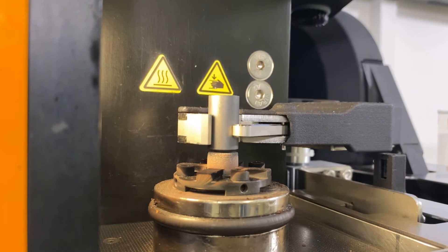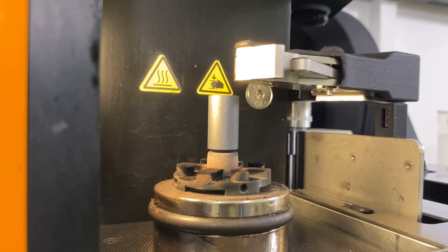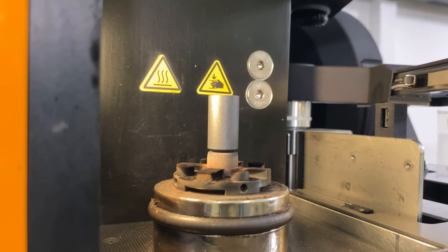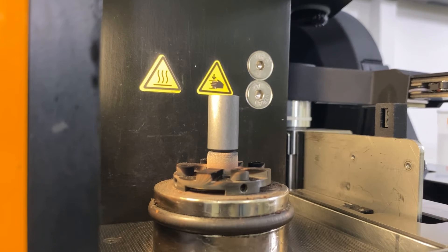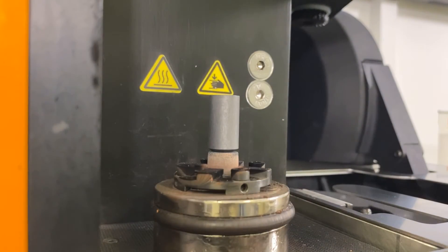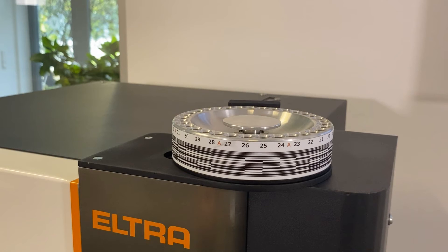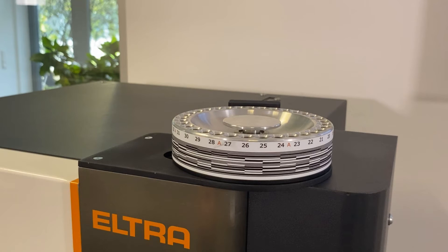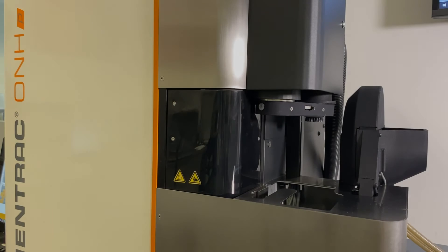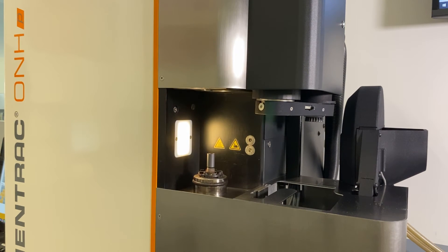The crucible is precisely placed on the crucible tip with the gripper and the furnace is closed. The sample, or the accelerator and the sample, are metered in via the sample carousel. At the end of the analysis, the furnace is opened again and the next sample on the list is processed.